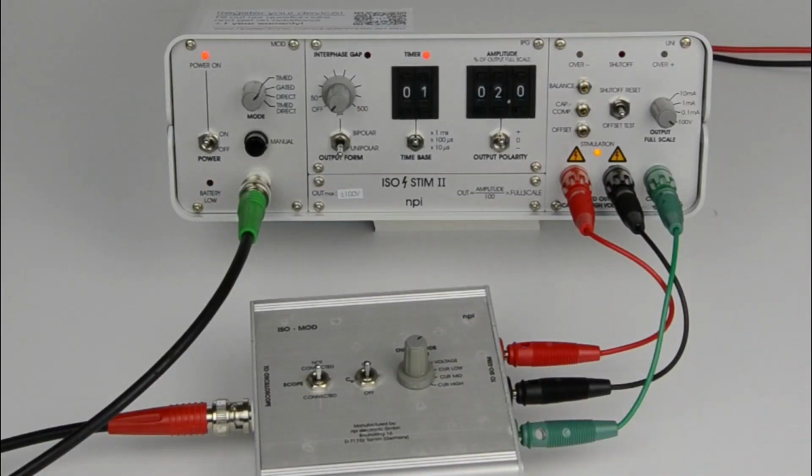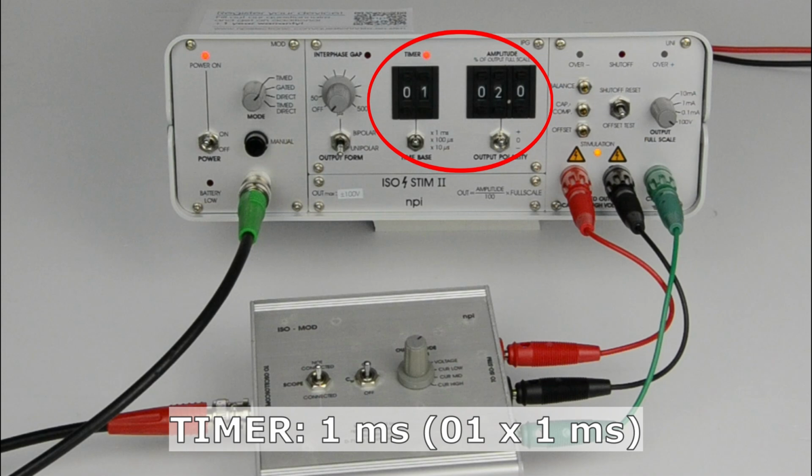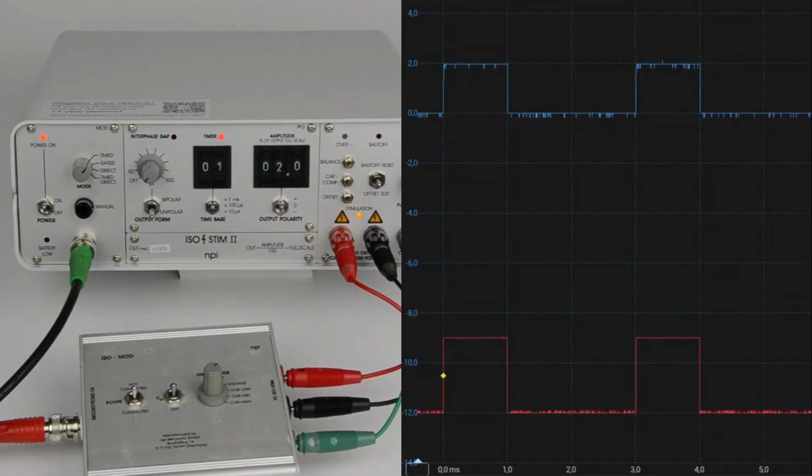To demonstrate the unipolar and bipolar output, we switch to timed mode. We set the timer to 1 millisecond and have an output amplitude of 2 volts. In unipolar mode, the ISO-STIM will create a square-shaped signal with the set duration and amplitude, here depicted as A.